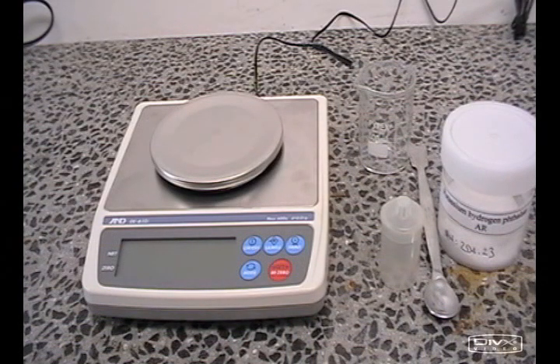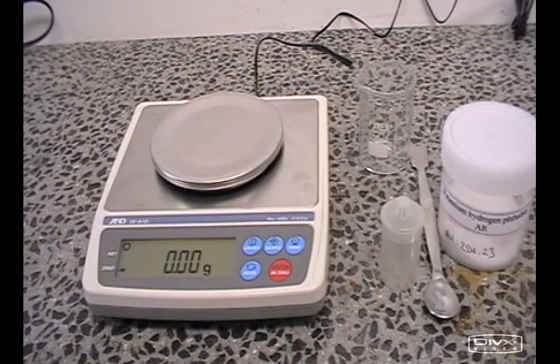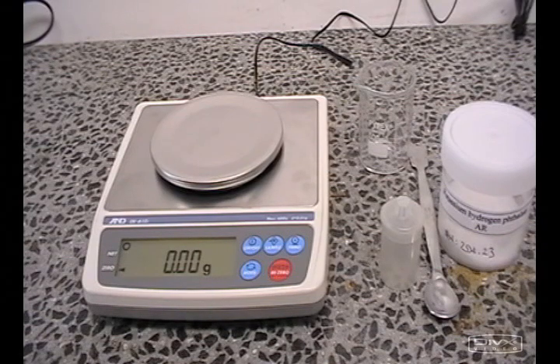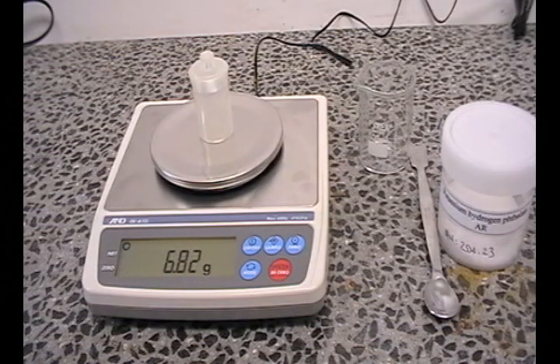Turn on your top pan balance and wait for it to stabilize. Once it has, place the empty weigh bottle with the lid on, on top of the balance. When you have a stable reading, tare the balance.